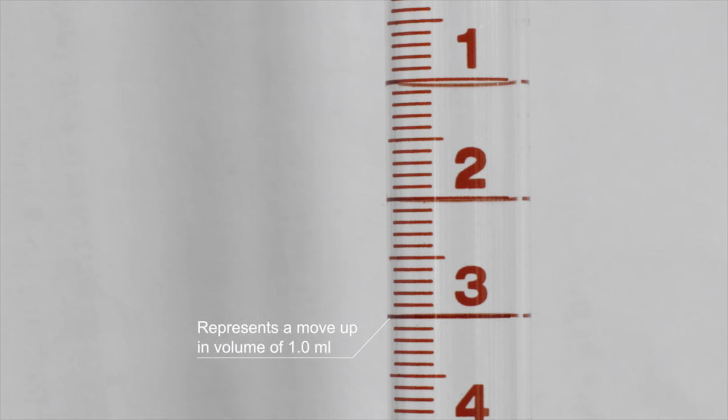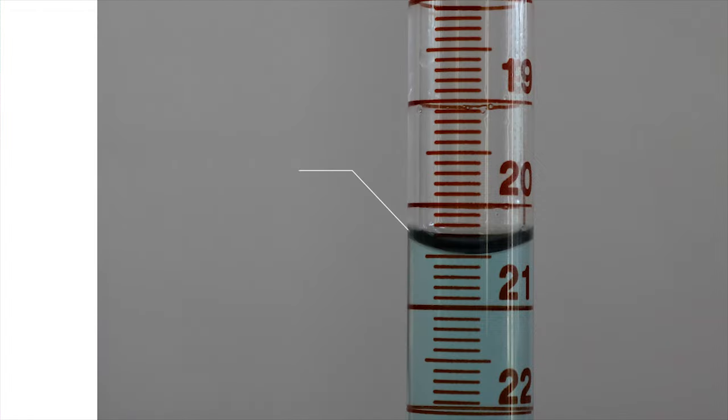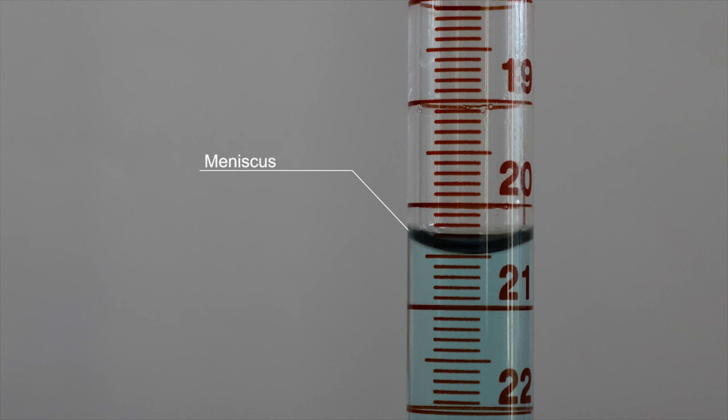Now that we know what the lines represent, how do we read a measurement off the burette? We first look at the meniscus and we note which two of the longest lines it lies in between. Of those lines, the longest line above the meniscus is recorded. In this example, the two lines represent 20 milliliters and 21 milliliters. So we record 20 milliliters as it is above the meniscus.